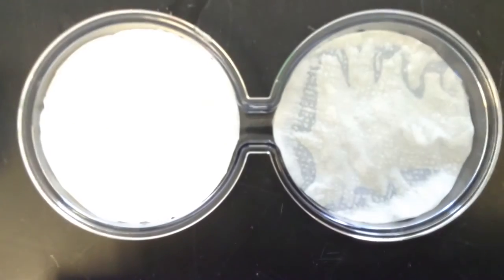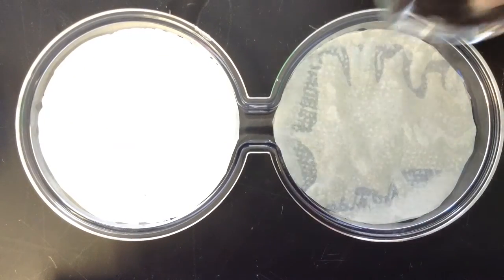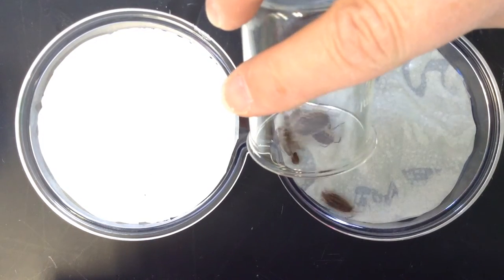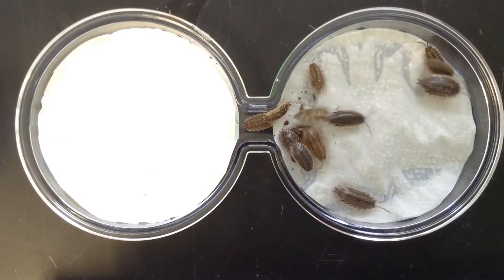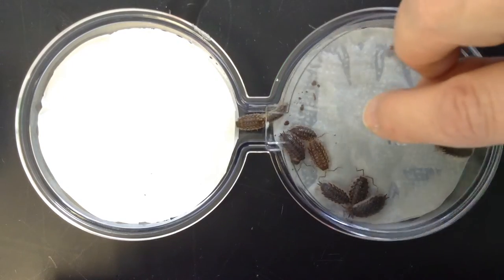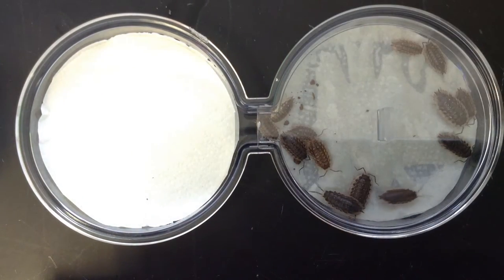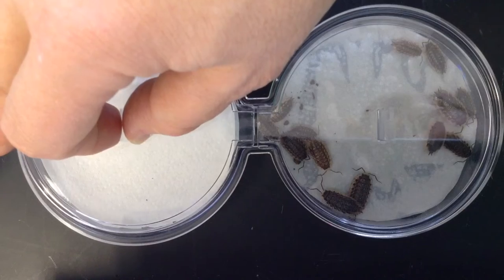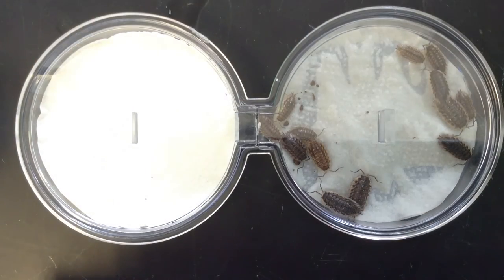Here's another view, and we'll put our little friends about in the middle. We'll just try to get them to spill out, and we'll give them a few minutes to let them decide where to go. And we'll put the lids on because these fellas do like to escape.